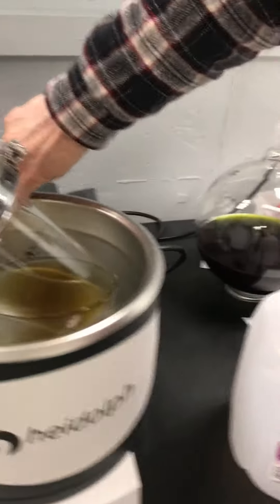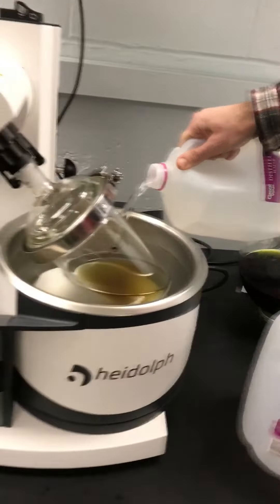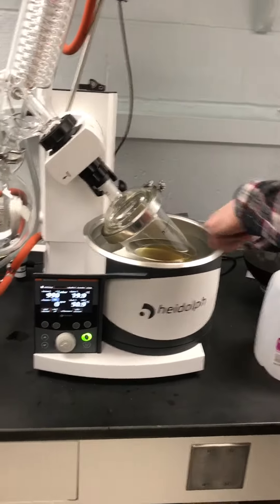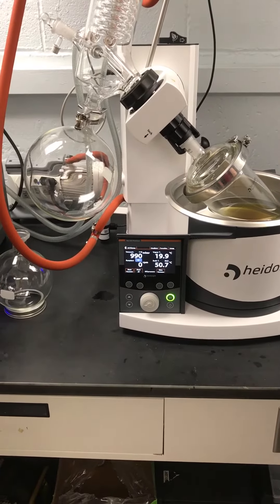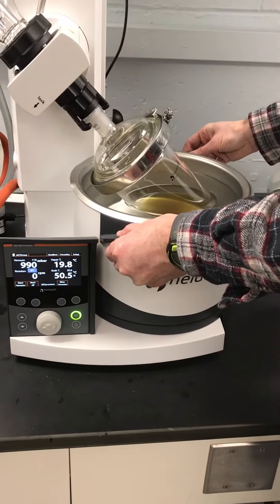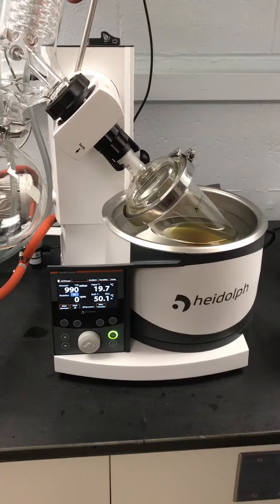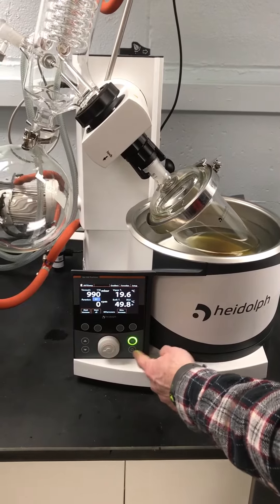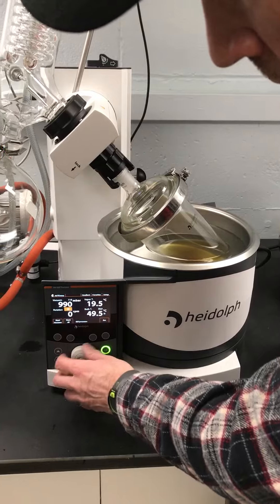And there's a top mark here. I'm going to fill up to the top because I want it to be submerged. And you can see it so you know that it is. But because of the geometry here, you're still right on the edge with a lot of glassware. So this moves, so you need to make sure that you're where you need to be. And then now I can turn on the rotation so that I can make sure that it's not going to bump into anything.